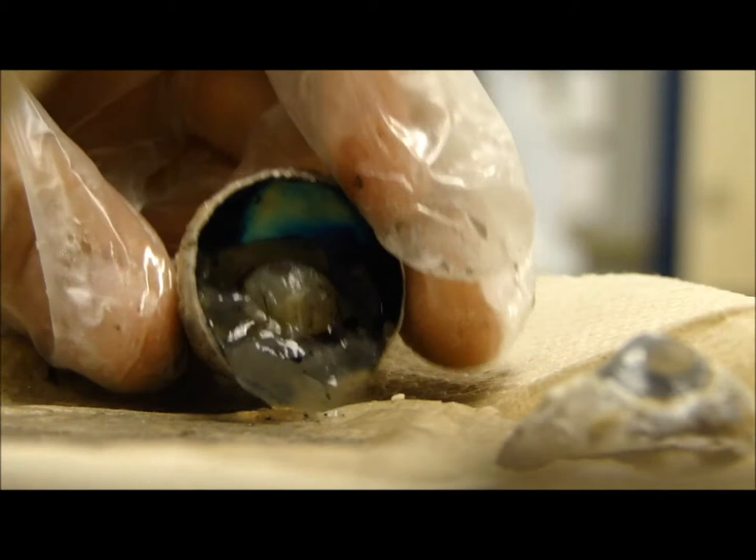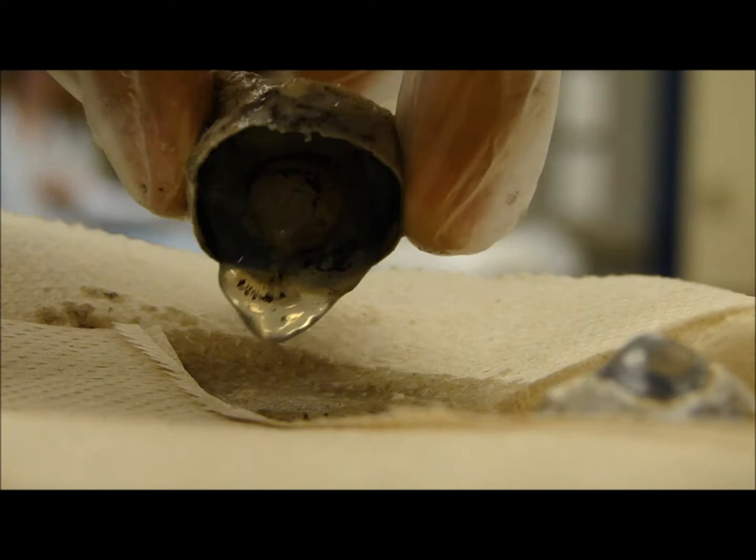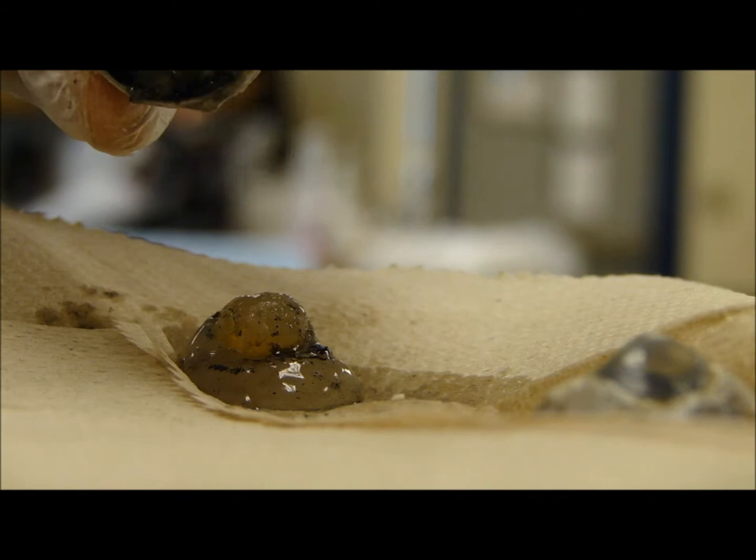It says tip the front portion over and let all the insides fall out. Let me see. Oh my gosh, put it out over here. Alright, it looks like a dead person. Let it fall out. You might need to gently scrape it. I'm trying to cut it around. Dude, all those juices just squirted out everywhere.